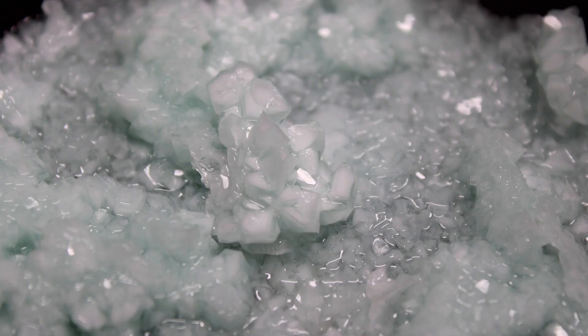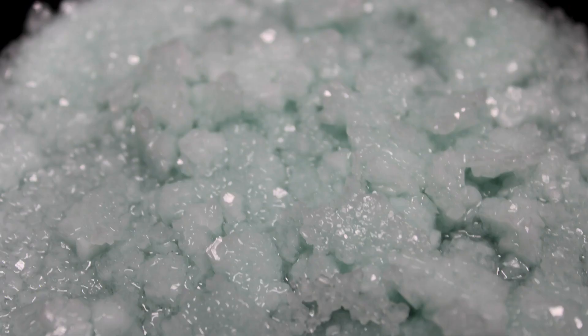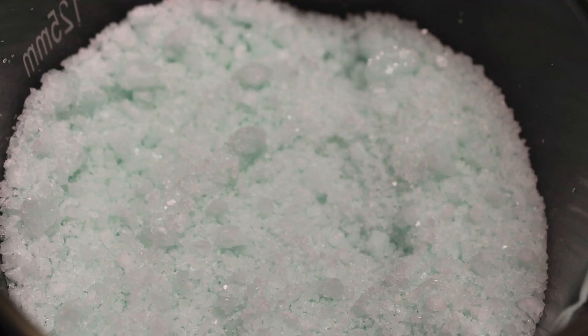Here are some glamour shots of the product. It forms lovely sea green crystals. In total, 167.87 grams of Mohr's salt are obtained. This corresponds to a percent yield of 85.6% out of a theoretical 196.07 grams based on starting iron, which is quite good.